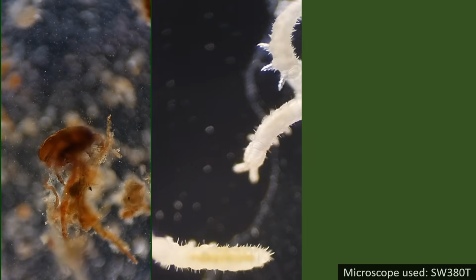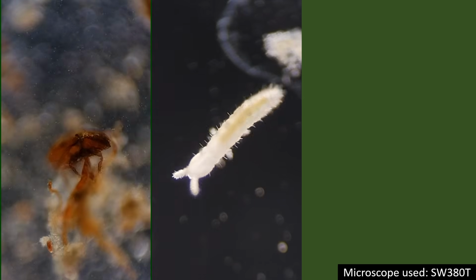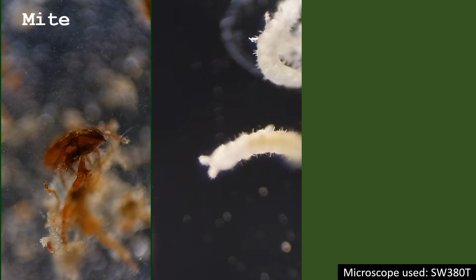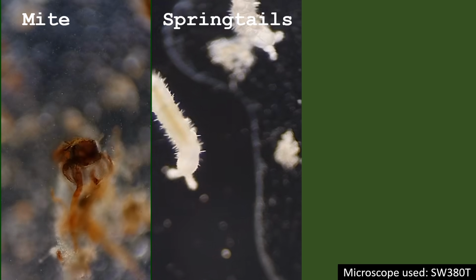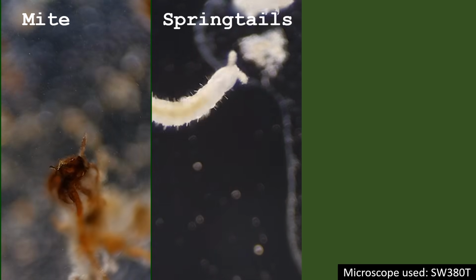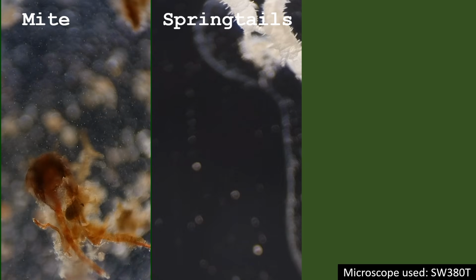While tiny organisms such as mites and springtails can also be observed in moss, I was not able to find them this time. So instead, I'm showing you some older footage. Each moss sample has different microorganisms at different concentrations, and the diversity of microorganisms found in moss is extremely high.